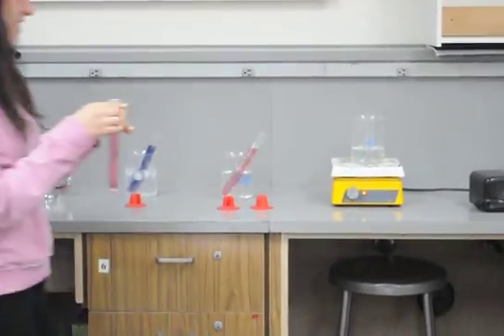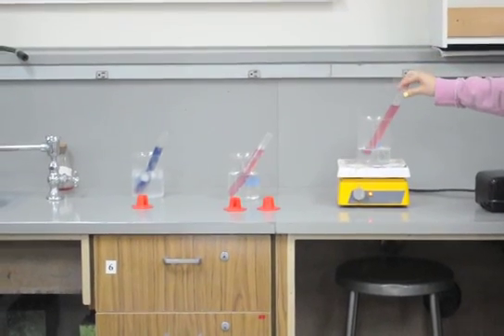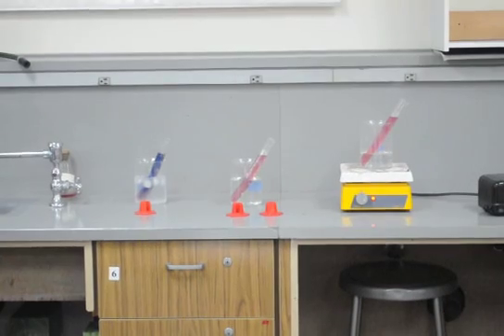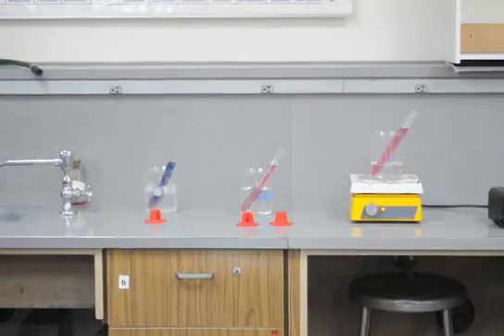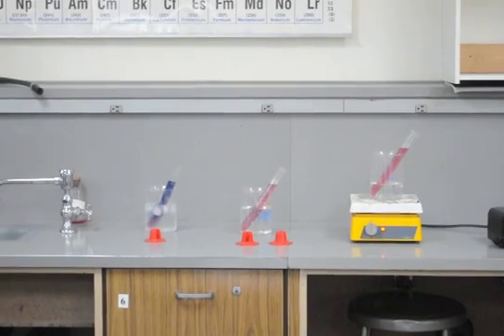No, it's not going to crack. Okay, good. Now, watch. Look at what's happening on the bottom of that blue tube already. Can you see it? Yes.